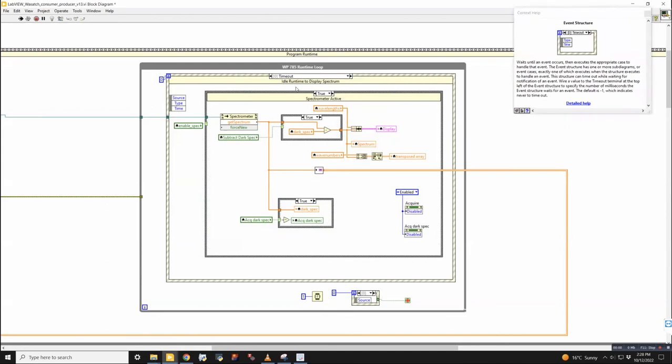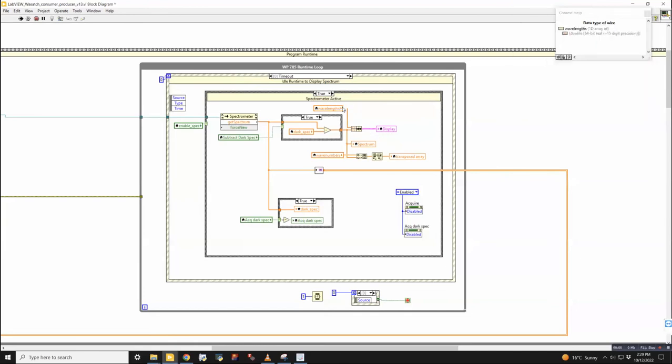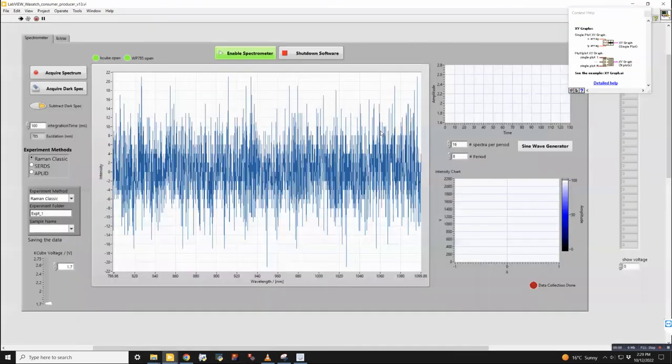Yeah, so this is the situation most of the time that it's going to be running in, the timeout. So that just by default is seeing if the spectrometer is on and will just continue to stream data out of the spectrometer to do anything with. So the first thing obviously is sending it into the display. So here we have the wavelengths that we got from the initialization, and we combine that in a cluster with the spectrum that's read out and send it into the display, which is this guy.